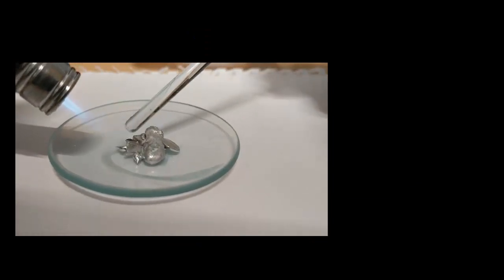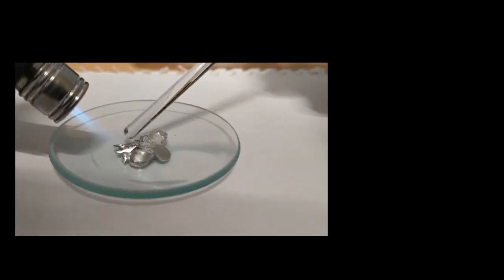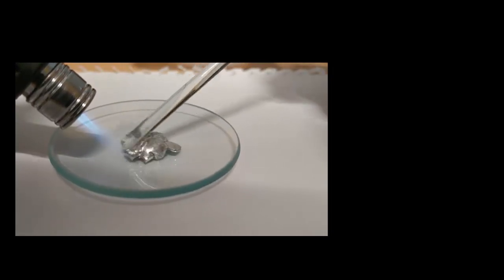I started this experiment following a procedure posted a while ago on Science Madness. I've provided a link down below if you want to take a look.